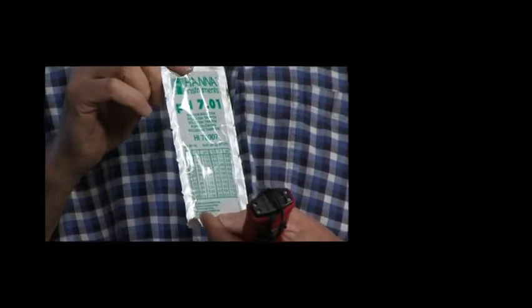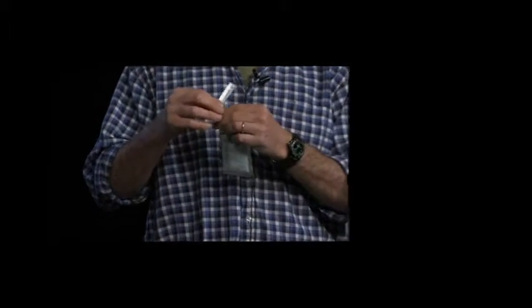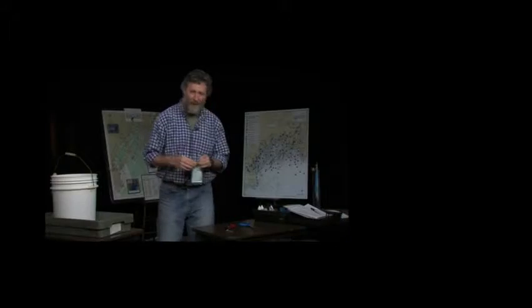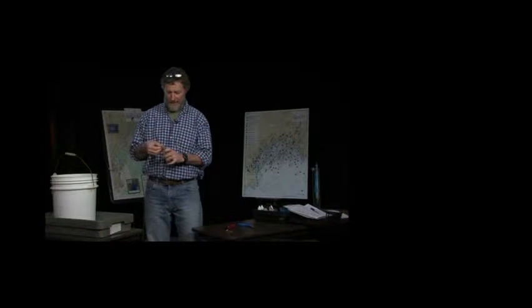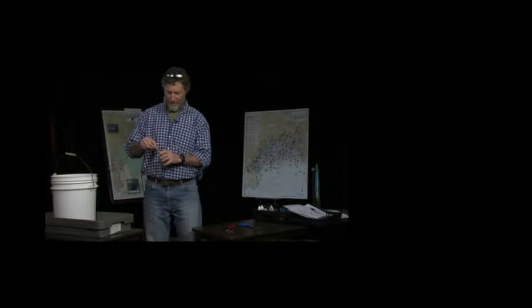The techniques for calibration are to take the packet and open it with a pair of scissors. This is something you can do at home. You want to do this in the comfort of your kitchen as opposed to being out on the rocky shore where you're going to do your testing. It's a little bit easier.